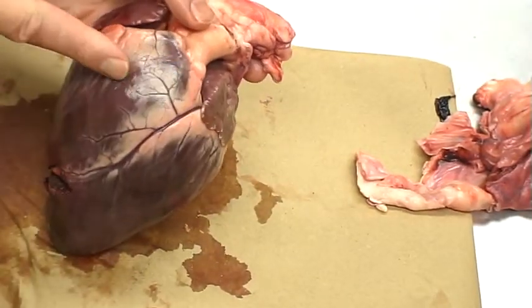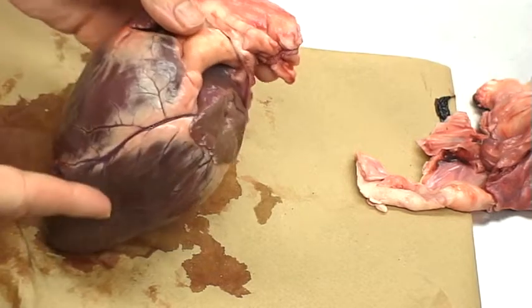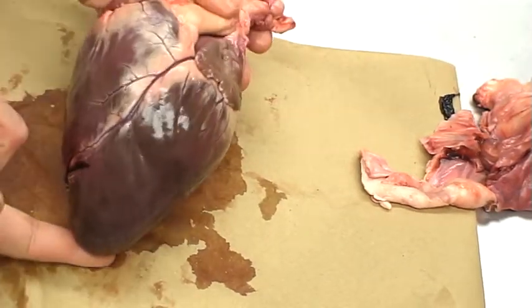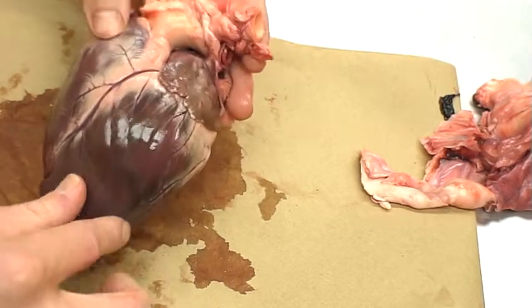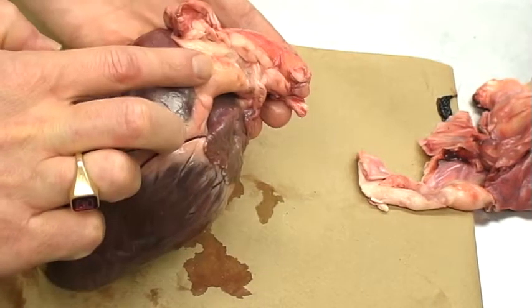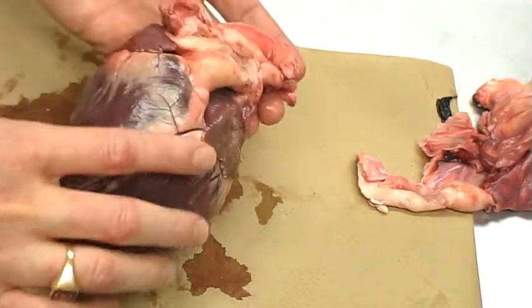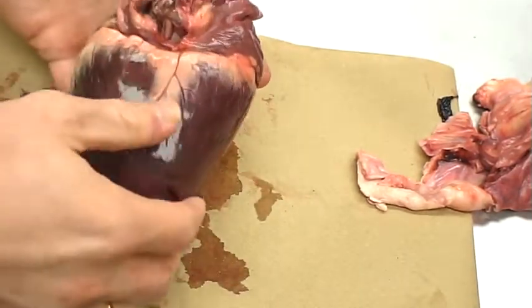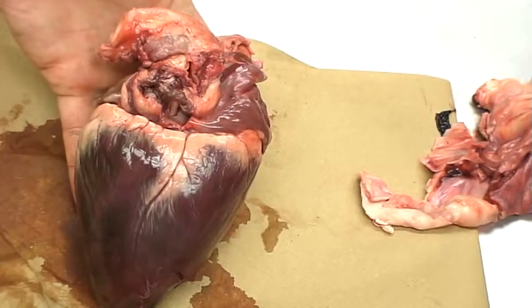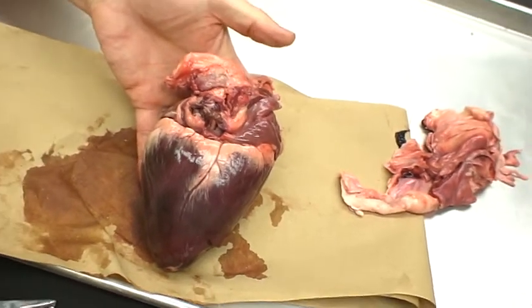First of all, we've got the base of the heart, which is actually up here. People always mix this up. The base of the heart is the widest part, and the tip is called the apex. Now, we need to figure out our right from our left. You'll notice that all the tube work kind of runs away from the front here. If I were to flip the heart over this way, we would see that it would go toward us, or toward the front of the heart.